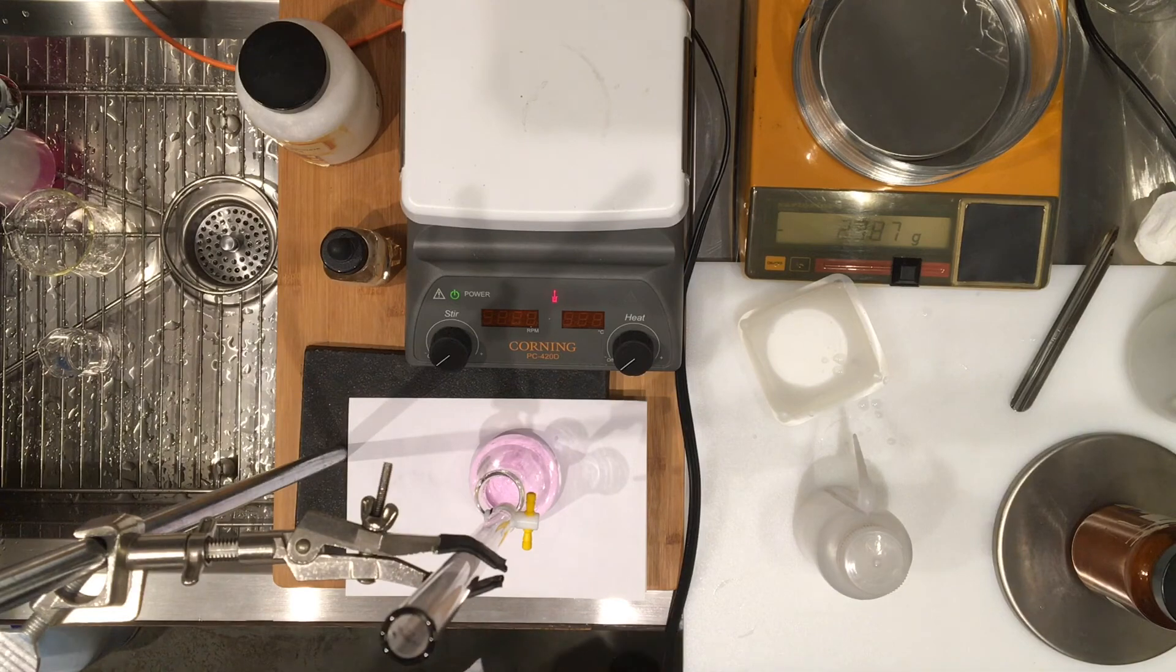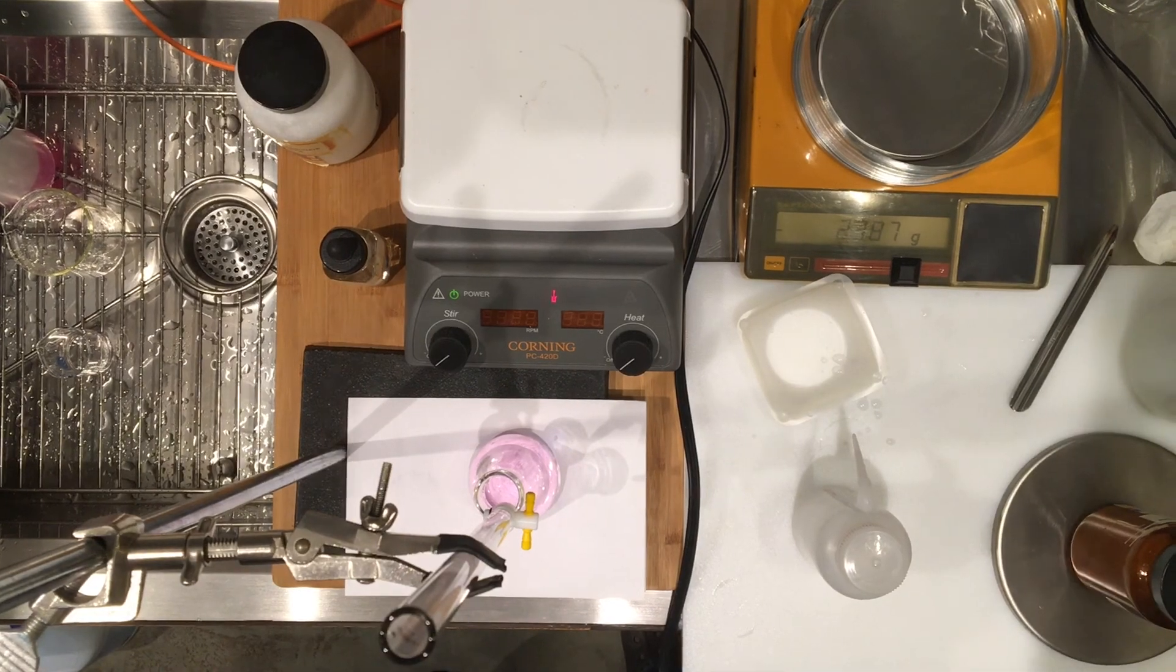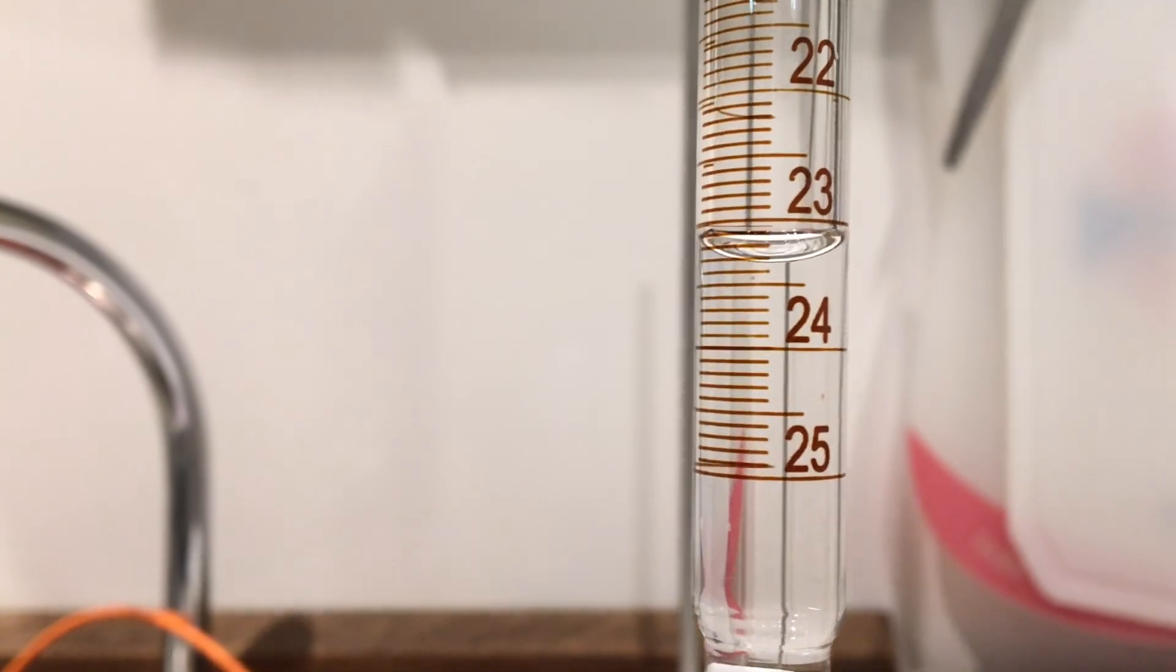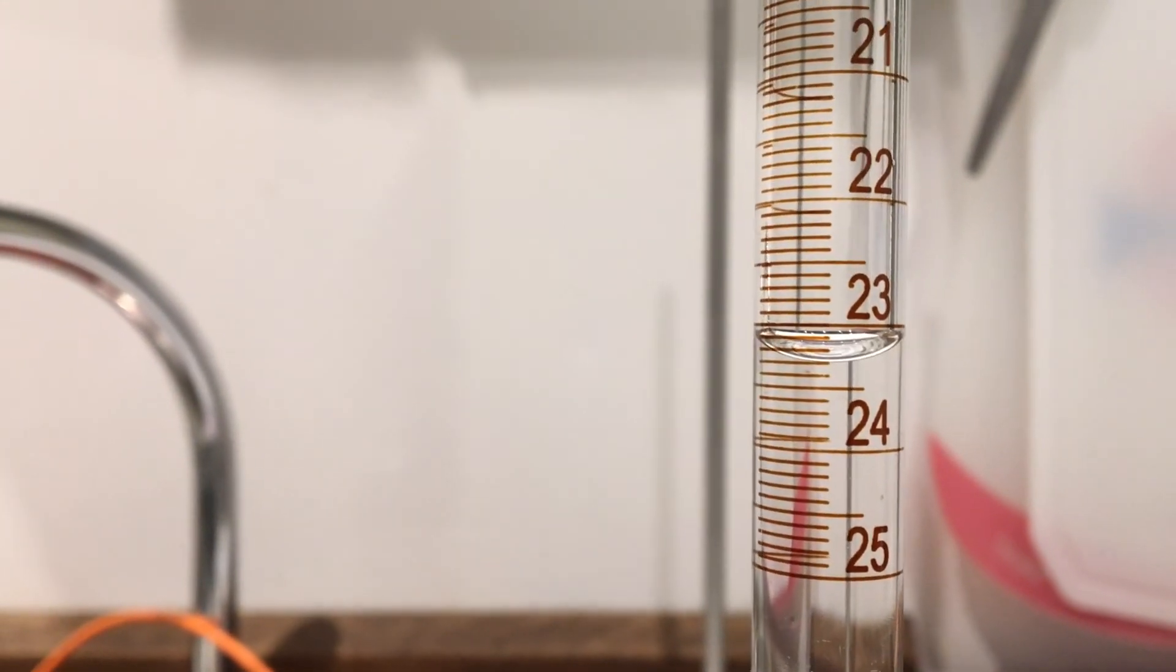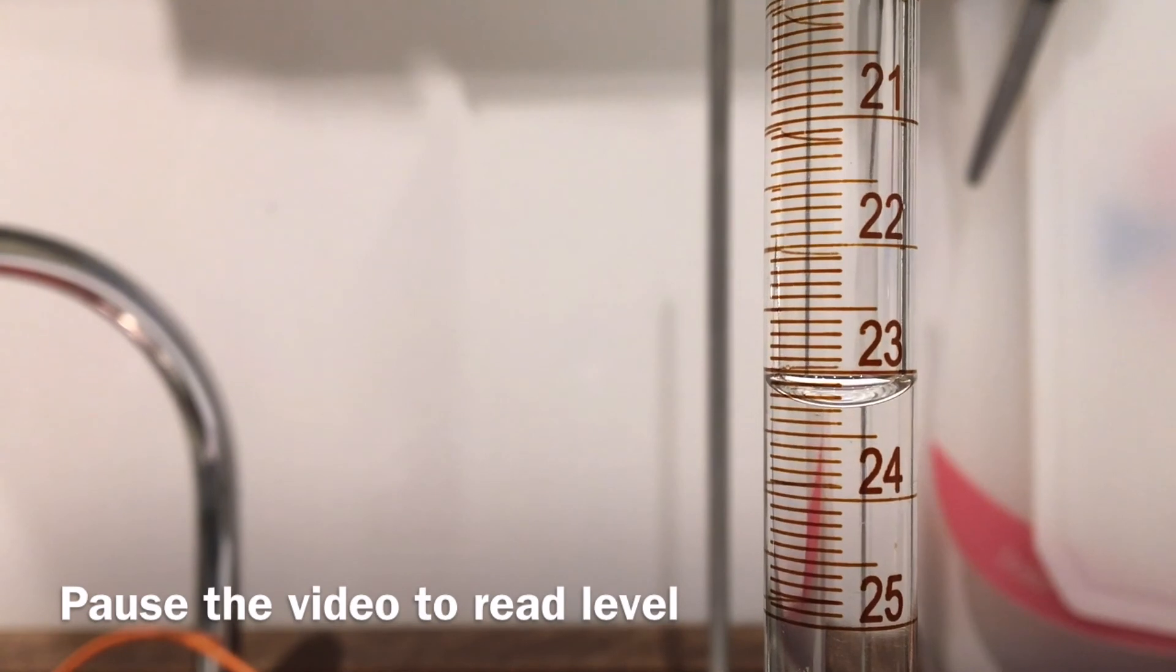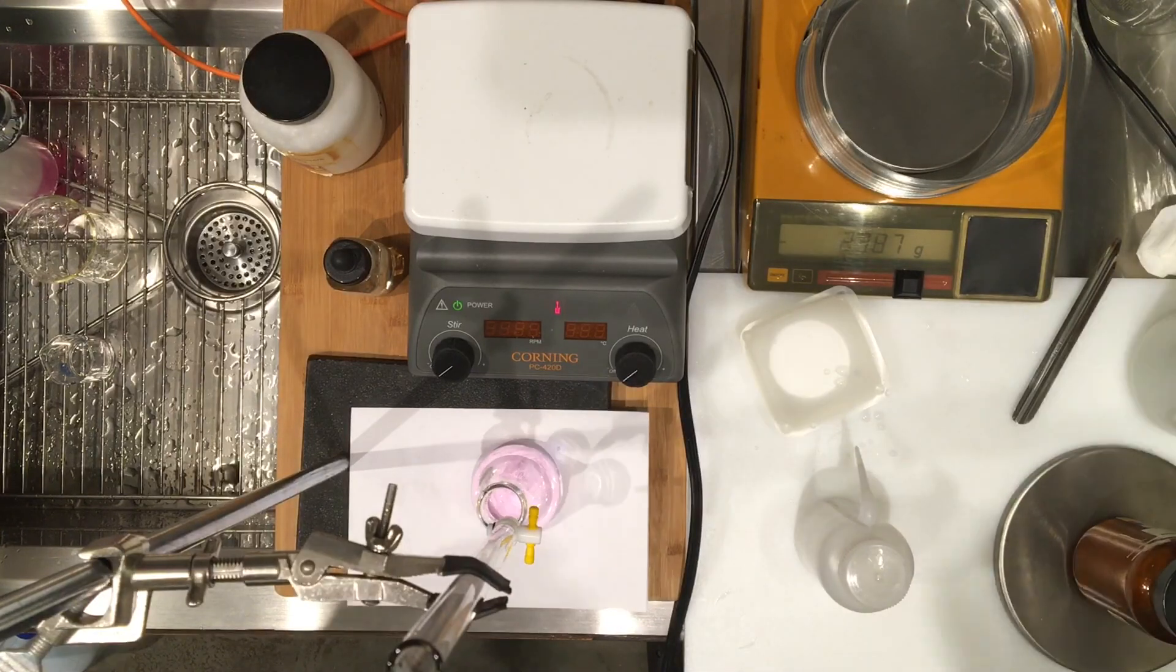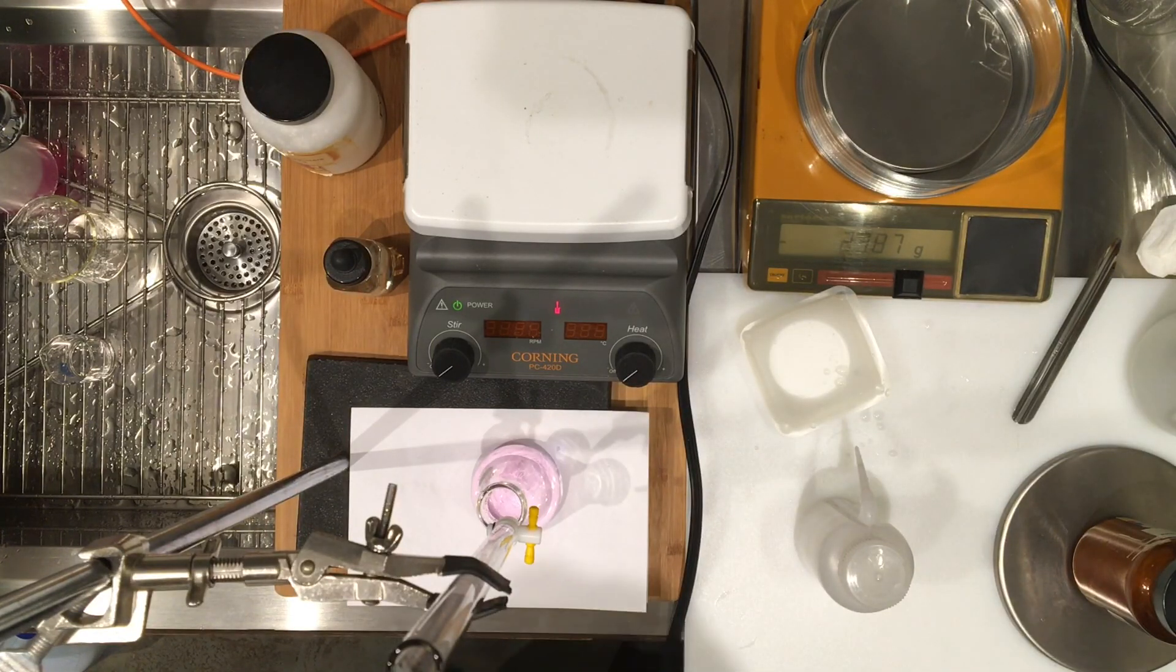I'm going to show you the volumes. I started with zero milliliters, so please record this other volume right here. We're going to do a third titration, and I'll show you that too.